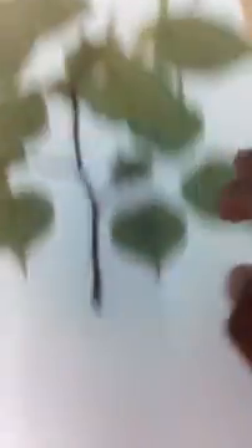So I'll place tape here, here, here, maybe here, and here. And then I'll flip it over and press those all down nice and tight to where it stays.